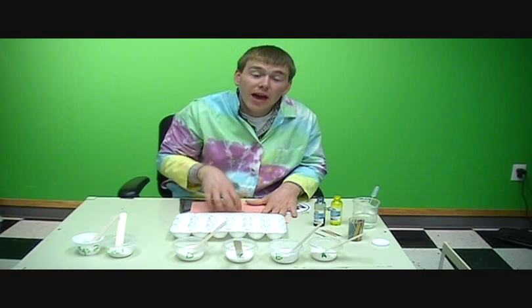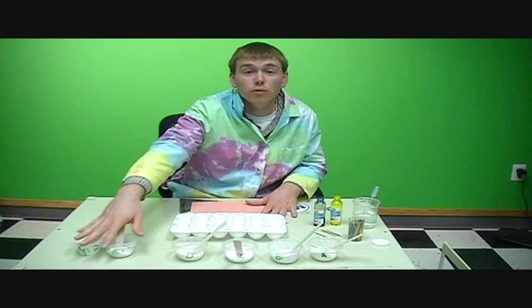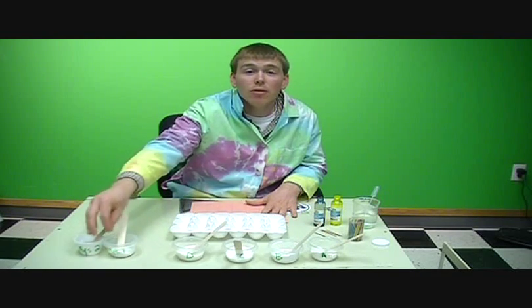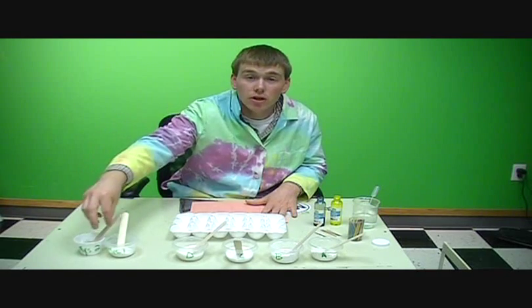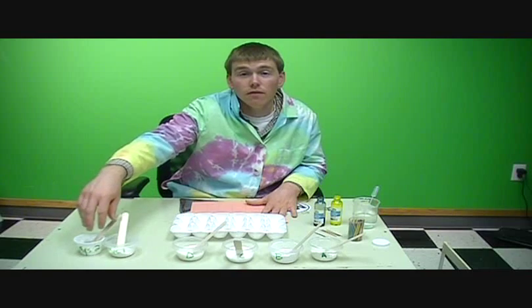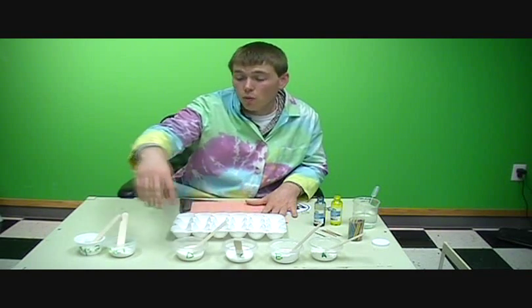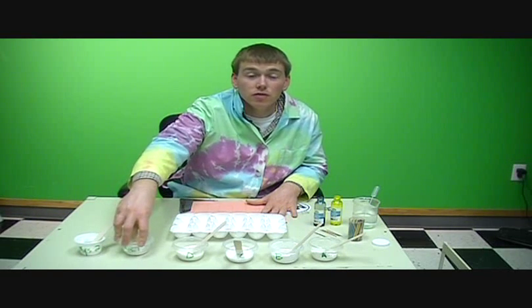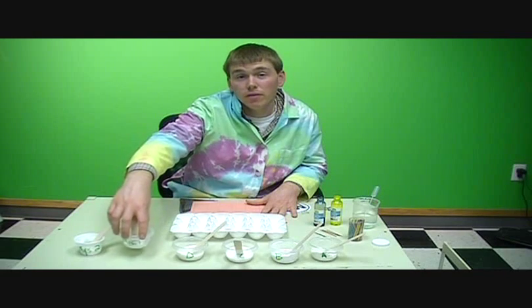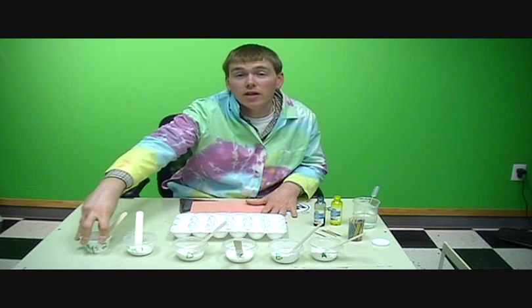And after they've tested each of these different powders, then they're going to test the 2 mystery powders. And these are the powders that were collected at the scene of the crime. So this is a mixture. Each of these powders is a mixture of 2 of these other powders. So one of them has, let's say, Mr. Mansfield and Grandma Mansfield dandruff mixed into it. And the other one might have Grandma Mansfield's dandruff and Susie's dandruff.